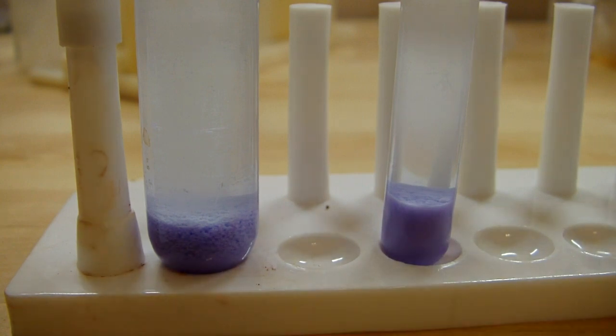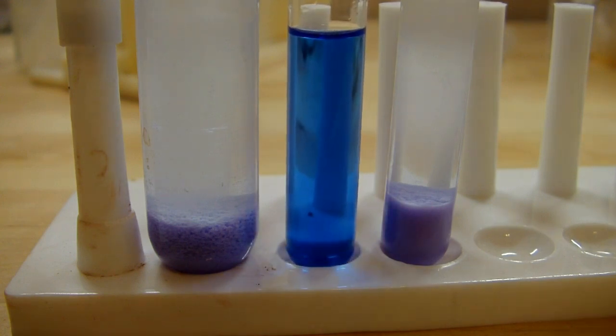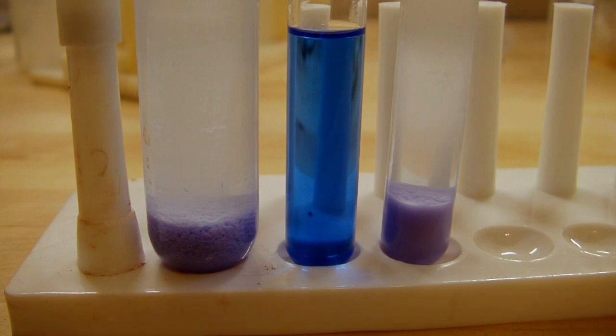Interestingly, I also tested ethanol as a precipitant and this is the result of that. You can see it didn't do anything at all. I had heard that ethanol could also be used in place of acetone because it's also less polar than water, but probably what happened with mine is I was using Everclear, the 75.5% ethanol version, and I guess that's just got too much water in it so it could never reduce the polarity enough to get the precipitate.